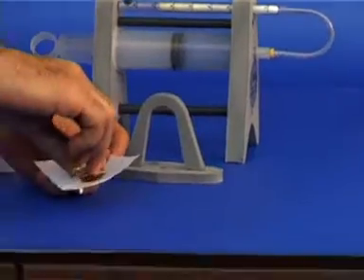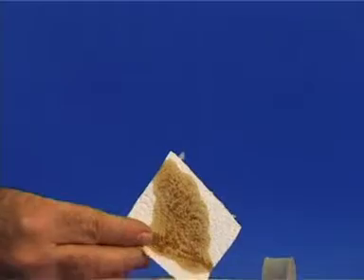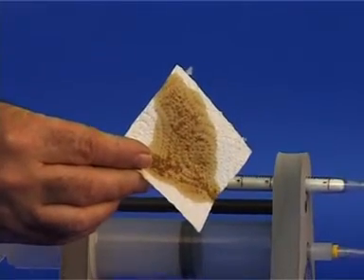Pour the black solution on a piece of filter paper and let the alcohol evaporate. What remains on the paper is what cigarette smokers inhale into their lungs.